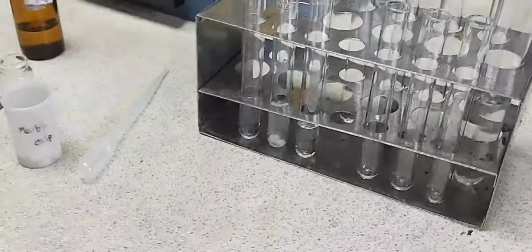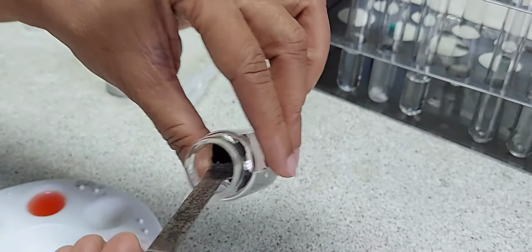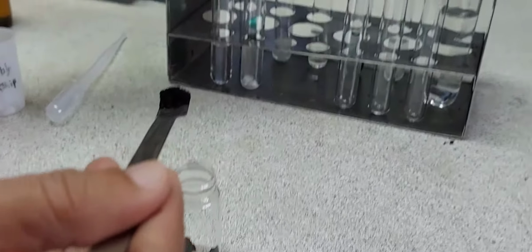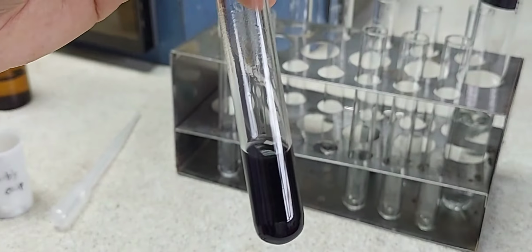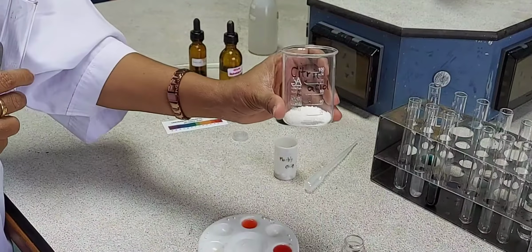So whatever you are observing in each of these reactions, you can make a record of that in a table, and then you can compare the speed of the reaction and what the reactions taking place are. So in this, I'm adding copper 2 oxide, a quarter of the spatula, shaking it, and I will keep it as per the other acids. This mixture has to be kept for some time to see the reaction taking place.